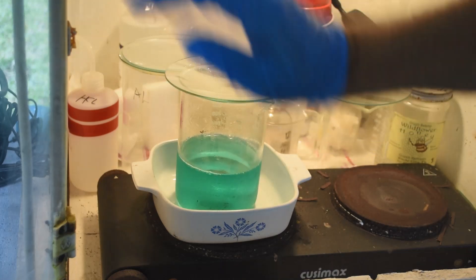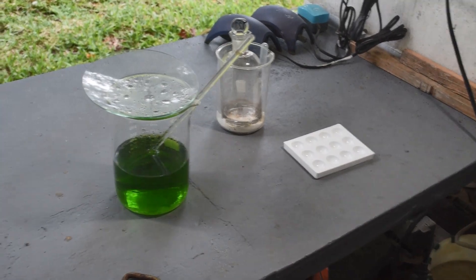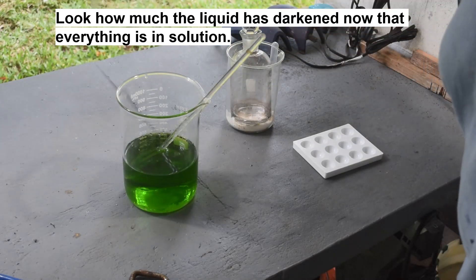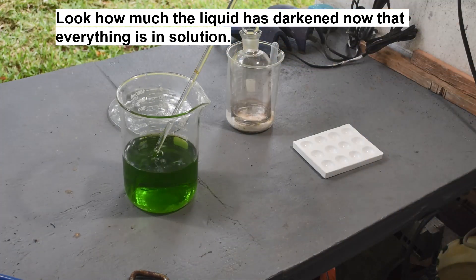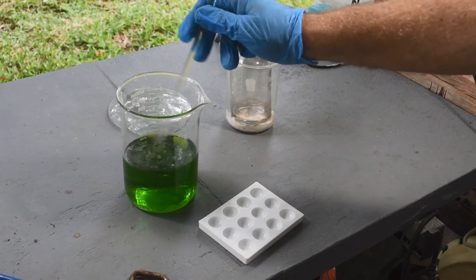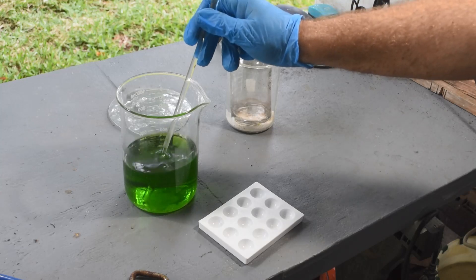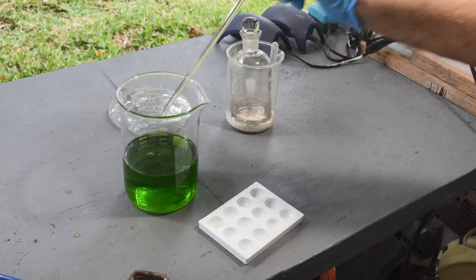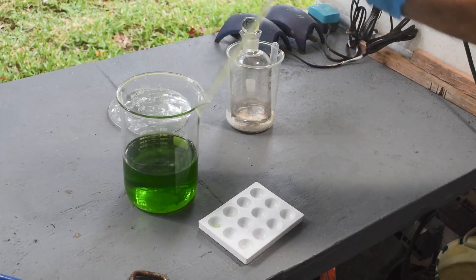We'll wait for this to heat up and get all that stuff into solution — at least everything that will go into solution — and then give it a stannous chloride test. I took this off the heat and wandered away for a bit; it got hotter than intended and actually started boiling a little. But maybe that was a good thing, because it looks like pretty much everything has gone back into solution, even that dark-colored sediment. So we should be able to test this with stannous chloride and see if there's any palladium left.